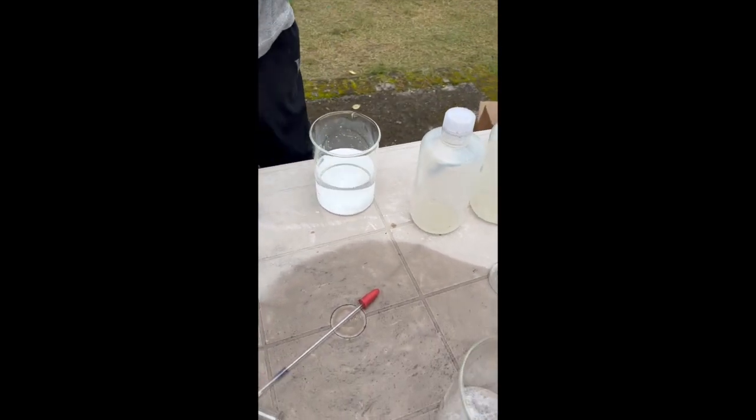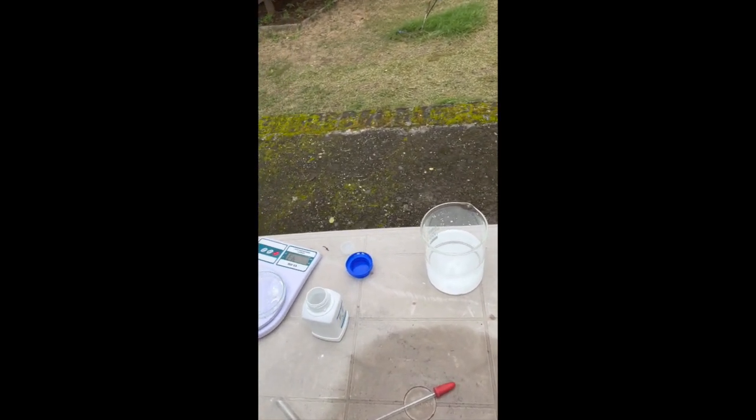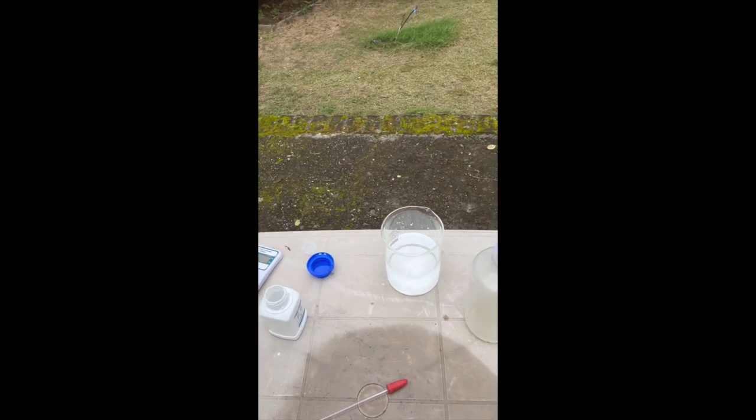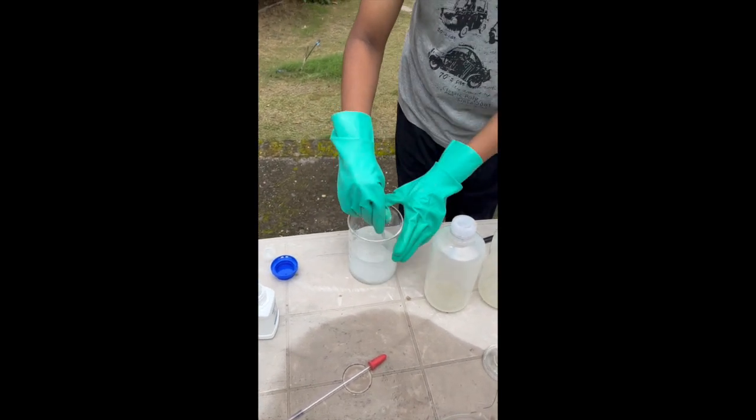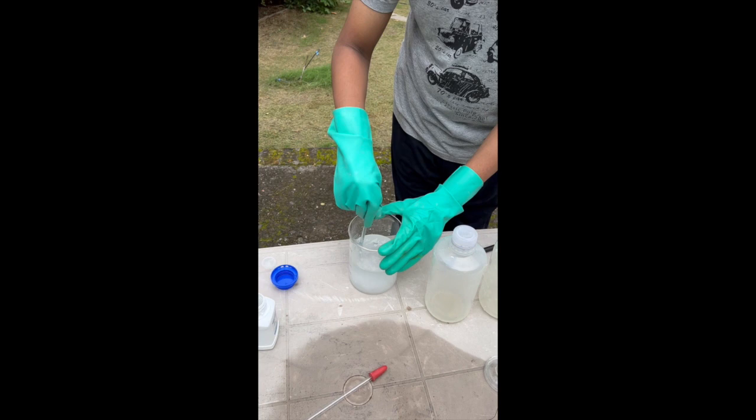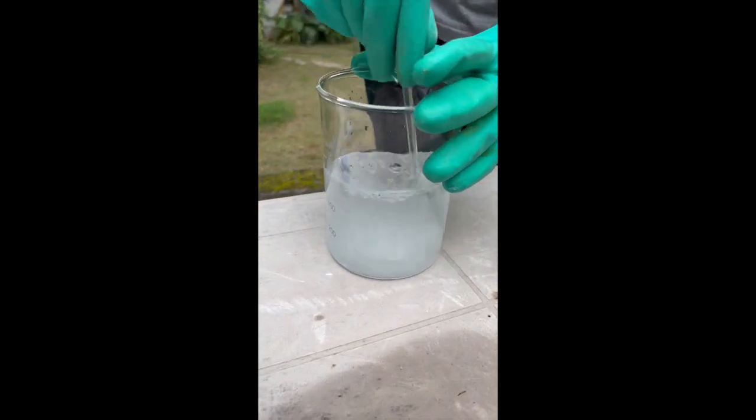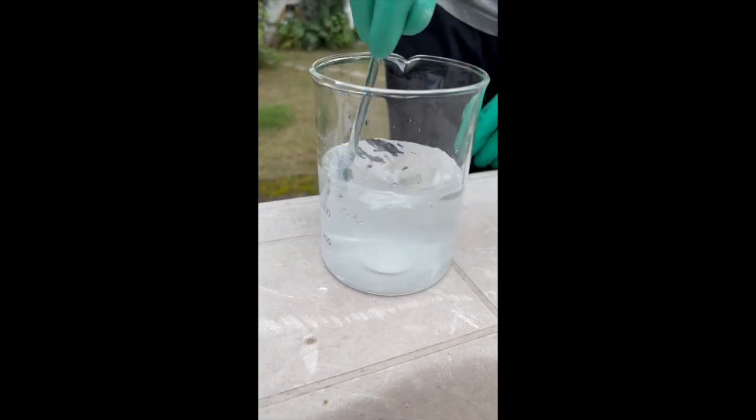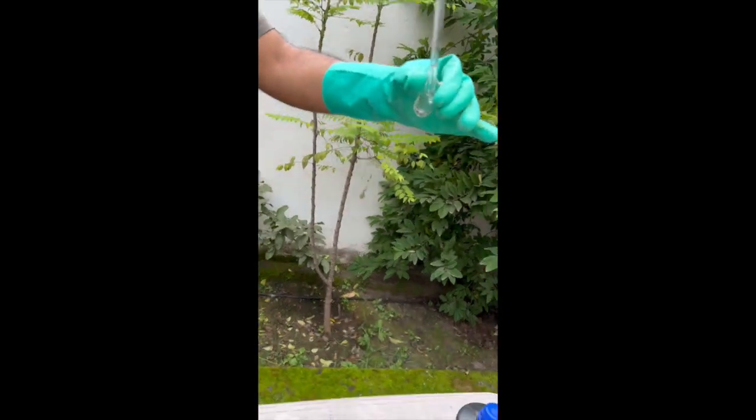It is very important to stir it properly till it completely dissolves. This might take a while, but eventually it will become colorless. I am going to make 500 ml of each solution, but the quantities can easily be scaled.